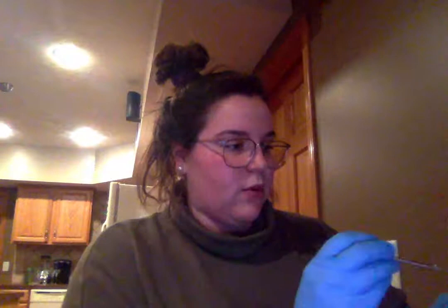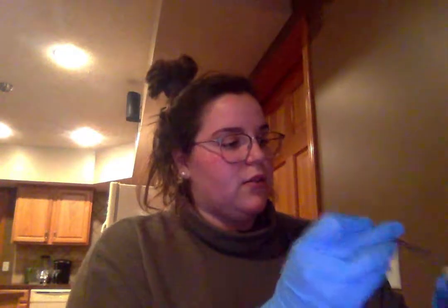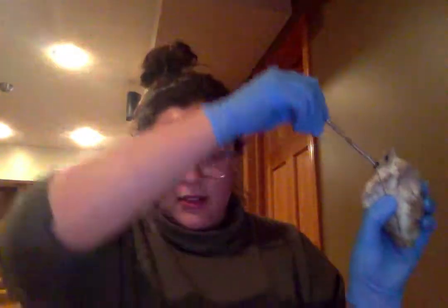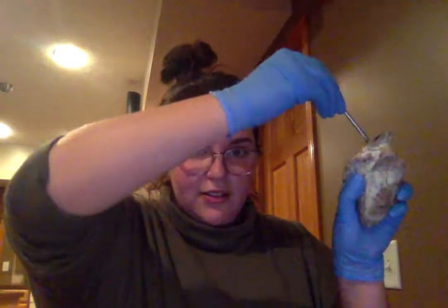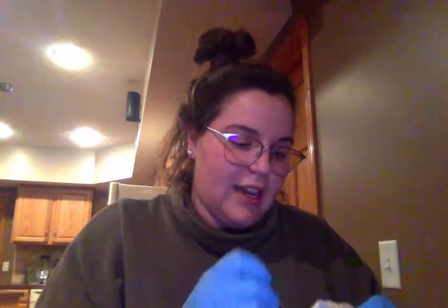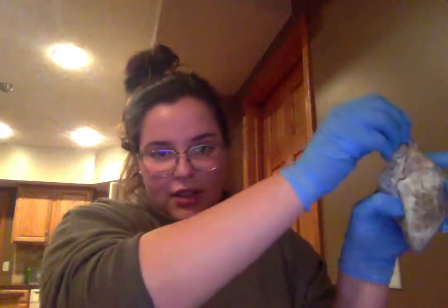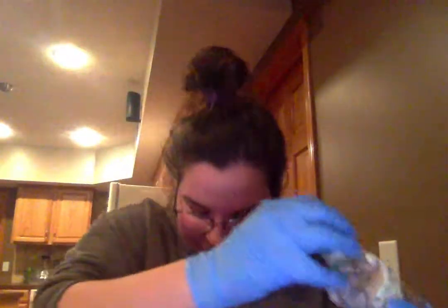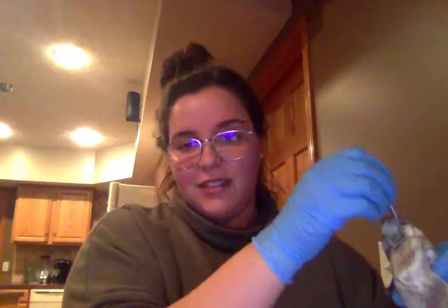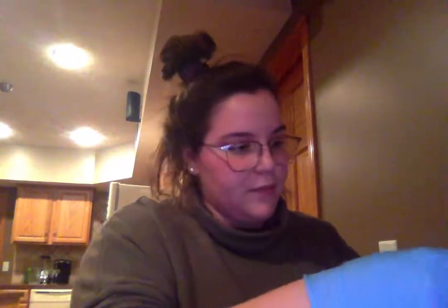Next, we have the aortic valve, which if I go to the left, okay, so the aorta right here, I stuck it in there. The aorta, if I put my probe through, I can get through to the left ventricle, down here. The aortic valve is in the aorta, between the aorta and the left ventricle.